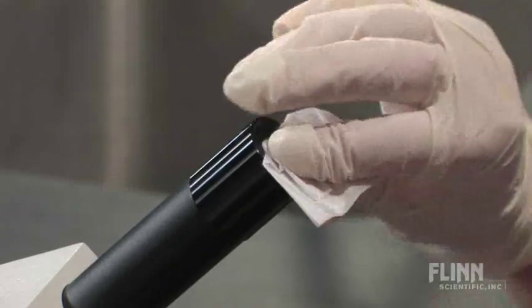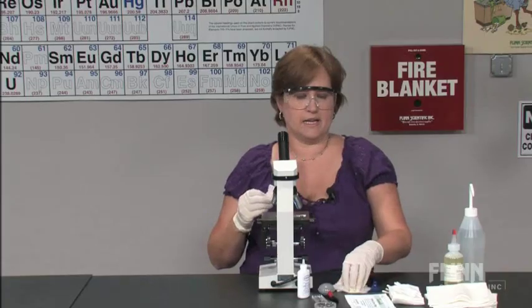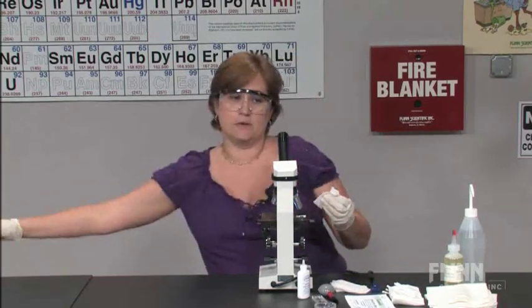You do not want to use canned air when you're cleaning a microscope, because many contain solvents that will damage the microscope.